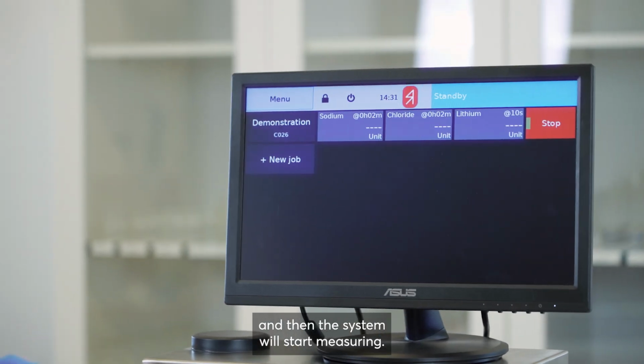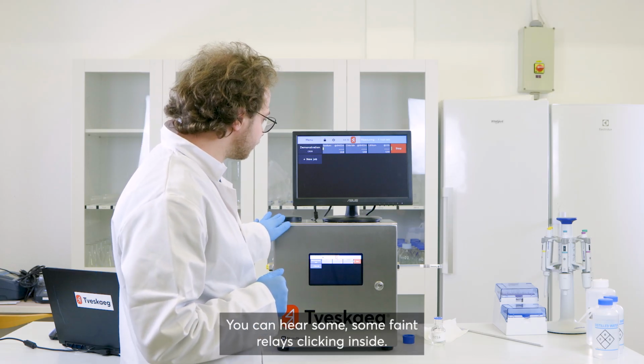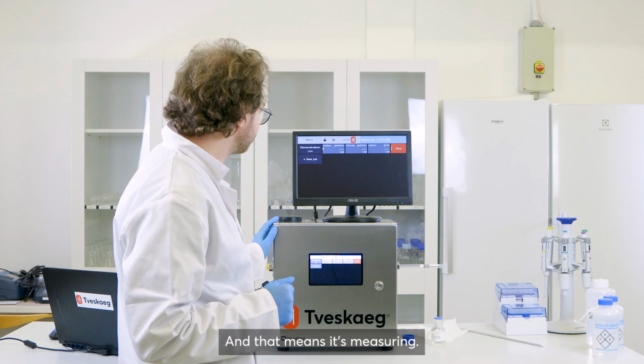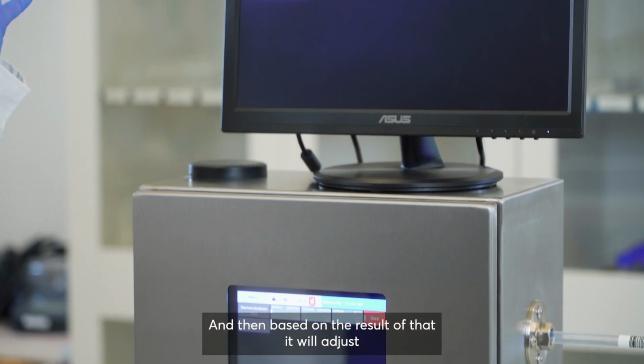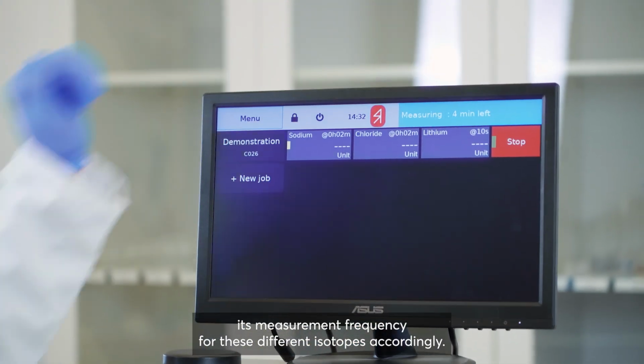And then the system will start measuring. You can hear some faint relays clicking inside, and that means it's measuring. Now it will measure on hydrogen first of all, and then based on the result of that, it will adjust its measurement frequency for these different isotopes accordingly.